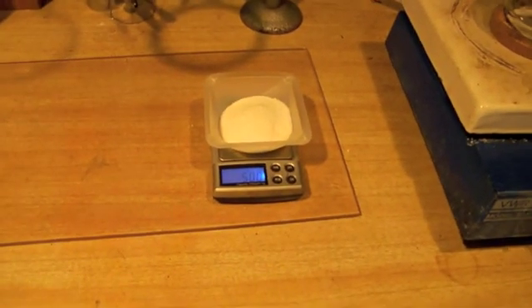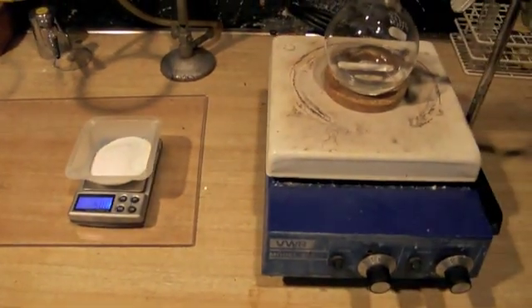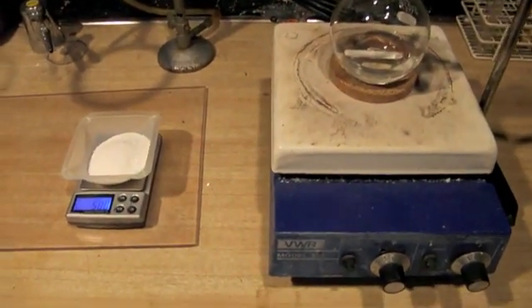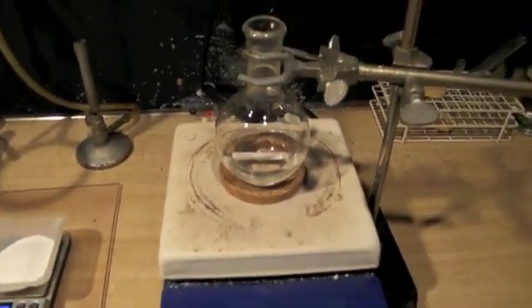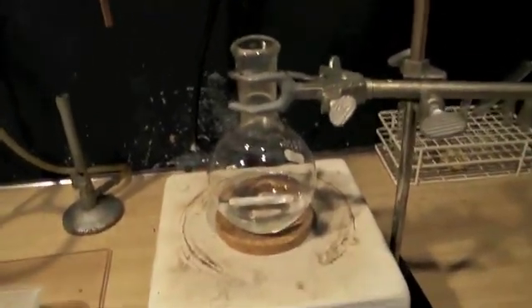The first step for the procedure is to generate the hydrobromic acid in the round bottom flask, which we will use to produce the elemental bromine.